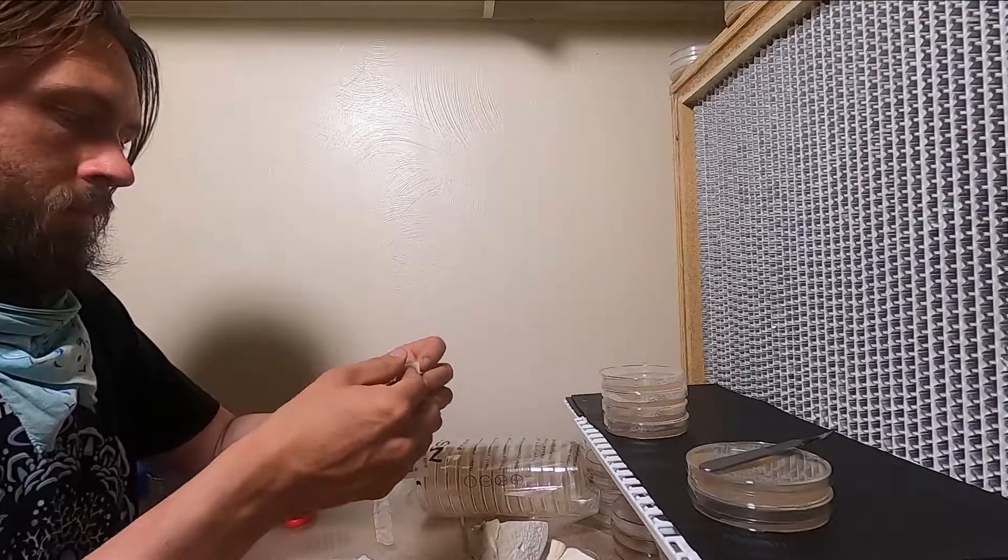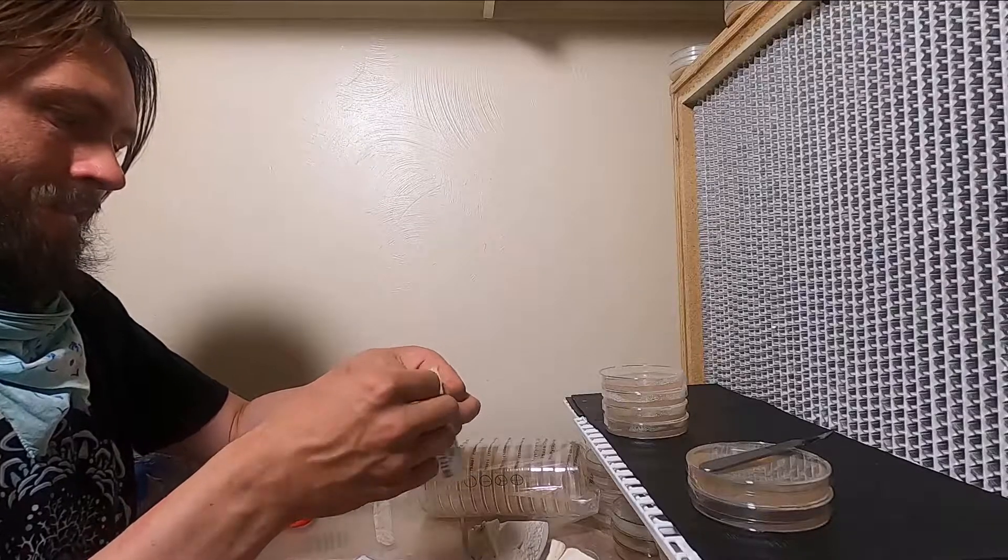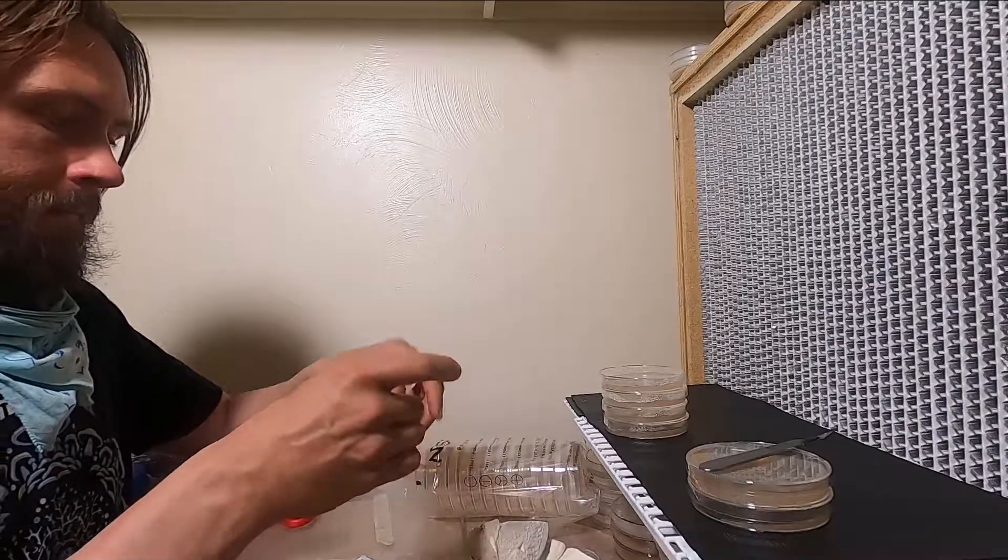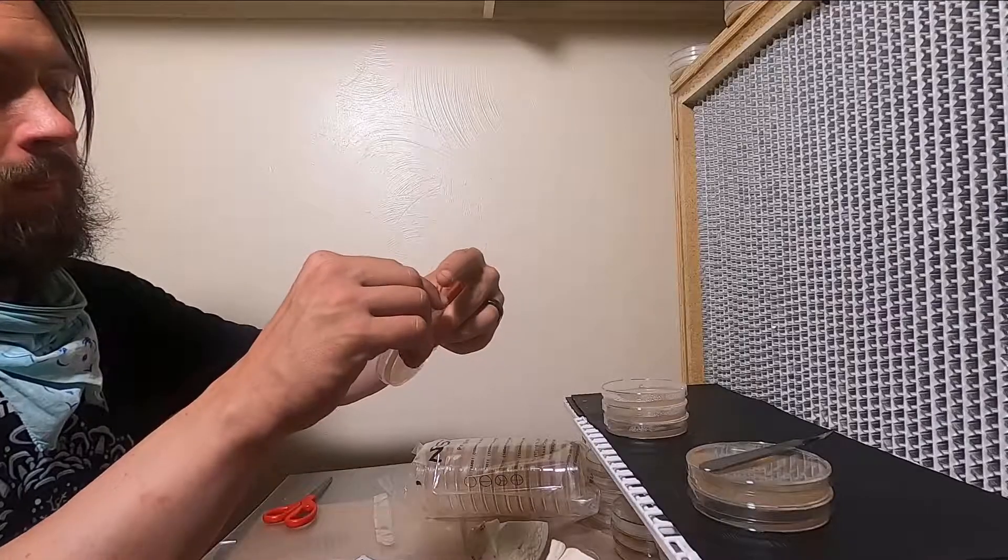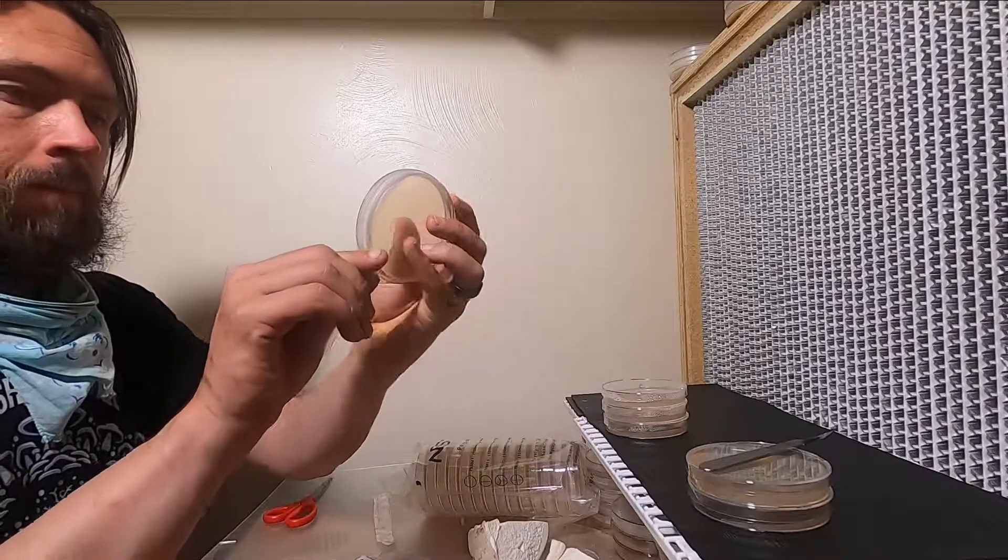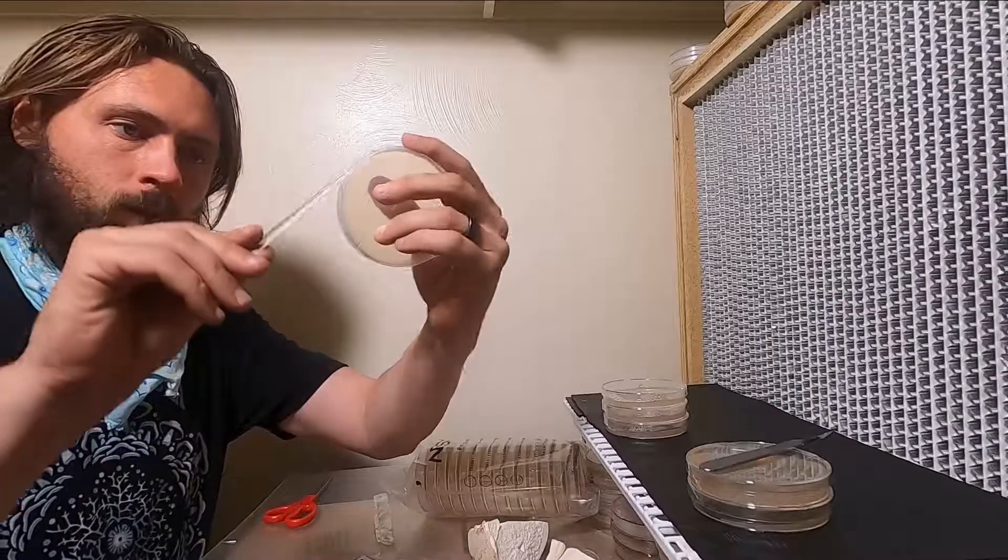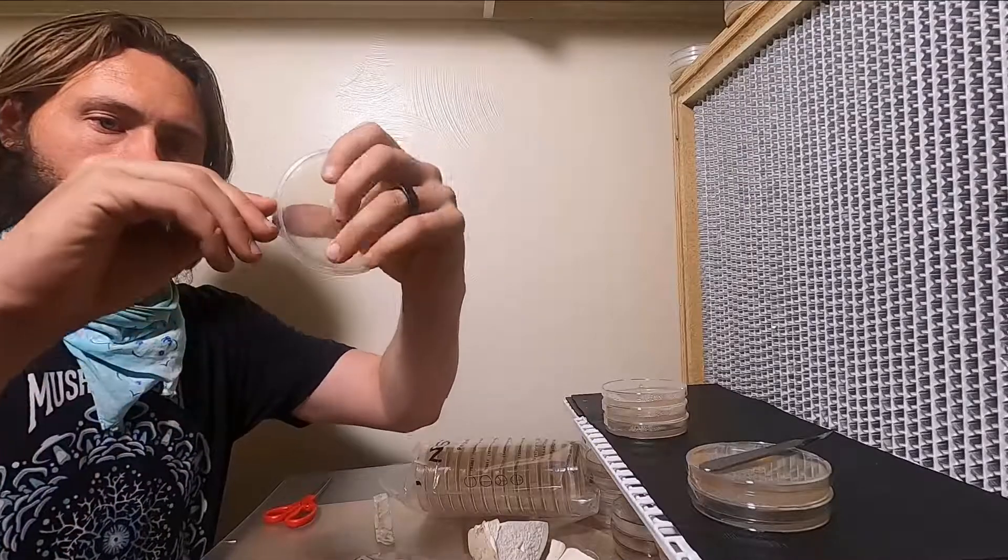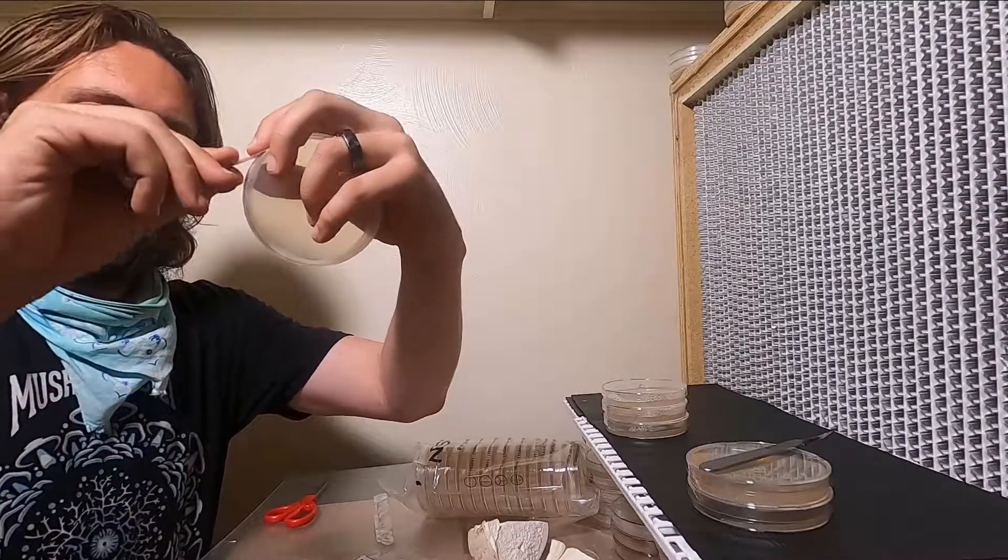And so what I want to do to make sure that they stay clean is use some parafilm and tape up all the plates. I just stretch it around. I can usually stretch it around two times all the way around the plate, overlapping on the bottom to make sure that no dirt or insects are able to get in.